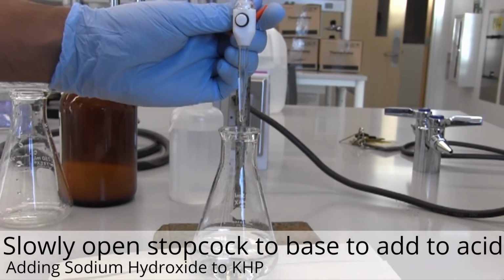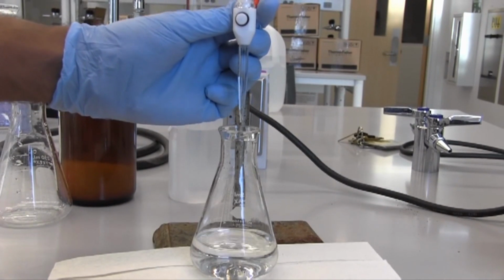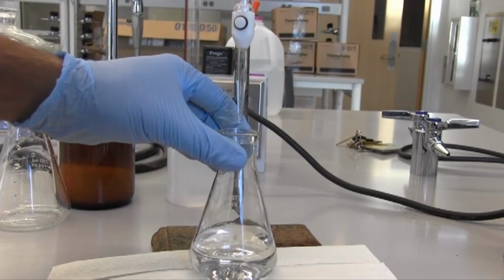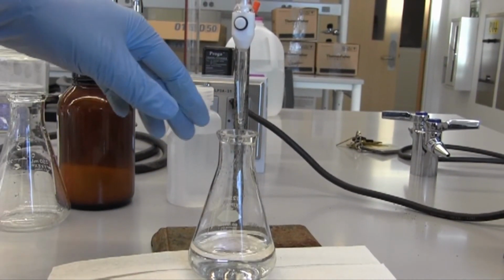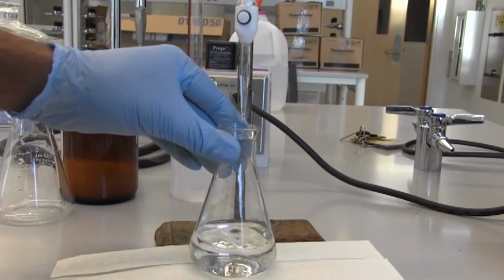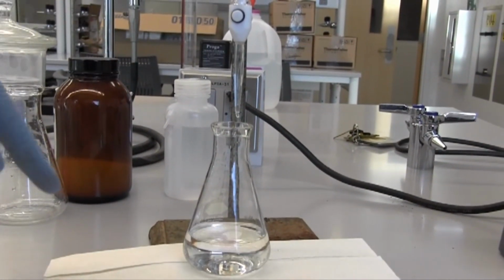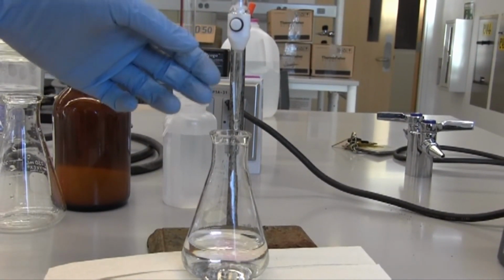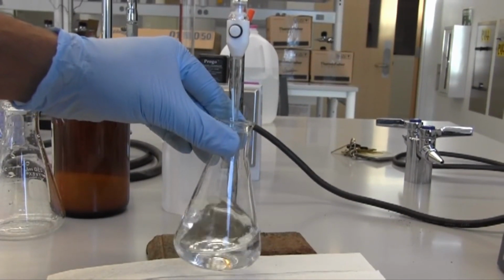We're going to change that by slowly opening our stopcock and putting base into our acid, drop by drop, to make sure that we don't go over the endpoint, which in our case will be when the moles of acid equal the moles of base. So right now there are more moles of acid in this solution than moles of base, but we're slowly increasing the moles of base. Once the moles of acid equal the moles of base, we should see a color change, and that signifies we've reached the endpoint.